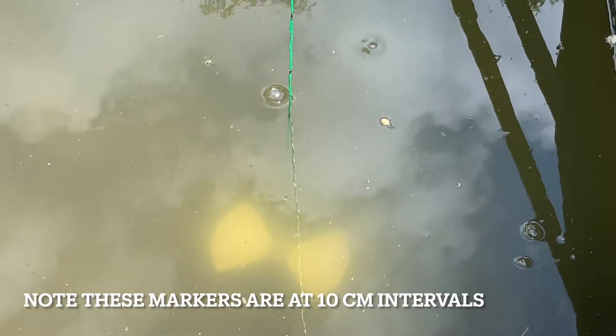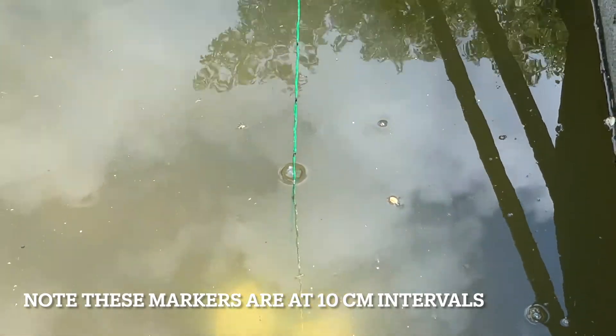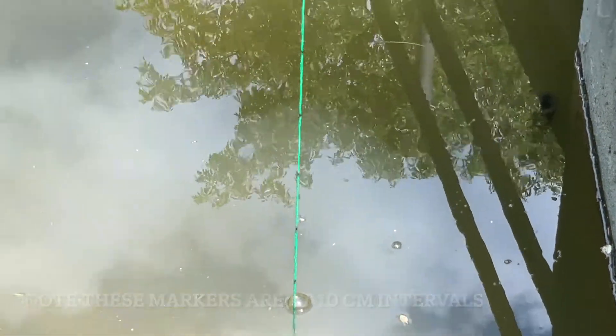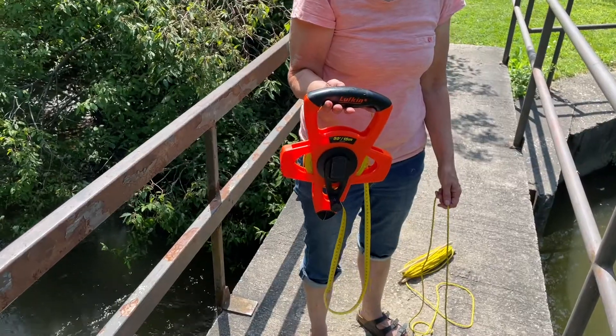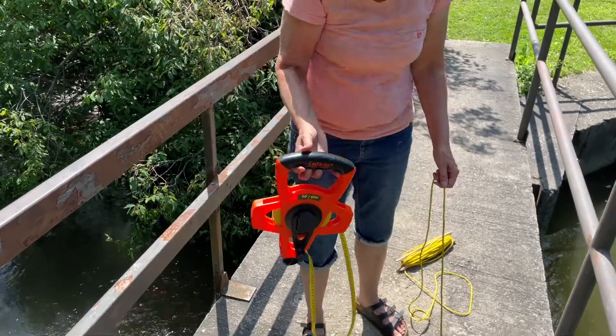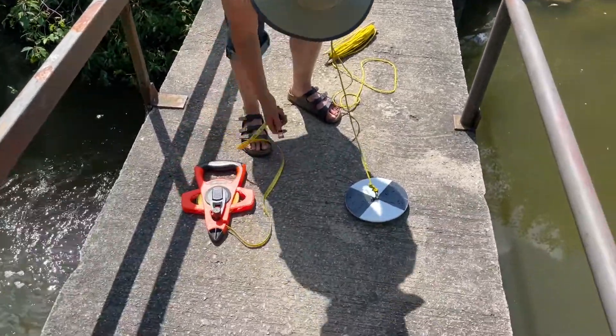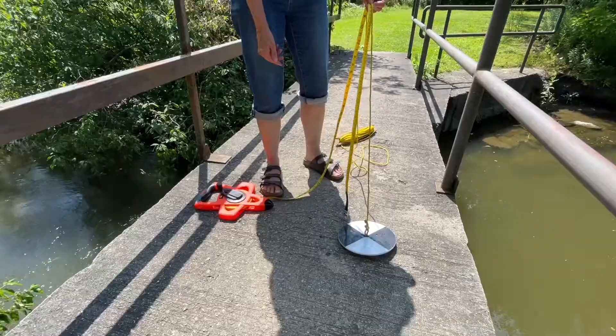This can be done by watching the markers on the string as the Secchi disk is lowered, or by using a measuring tape. Record the value and be sure to wind the string back up nicely.